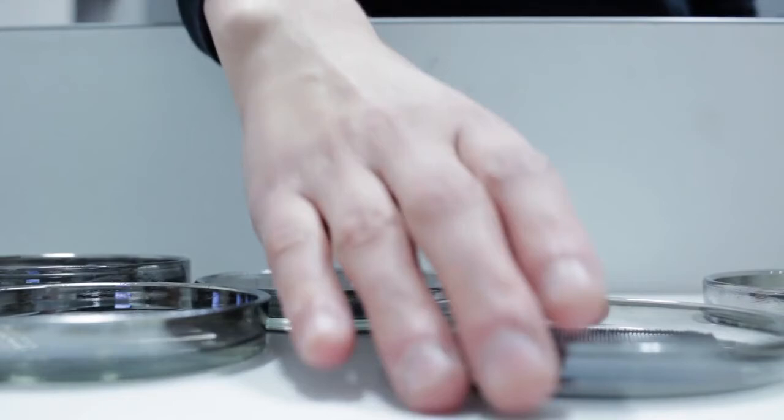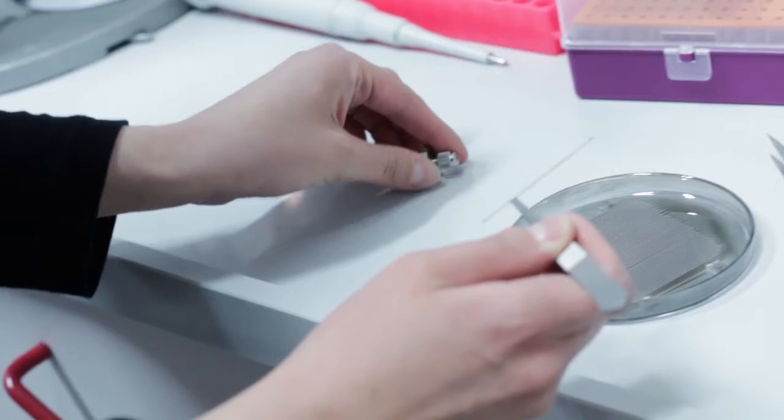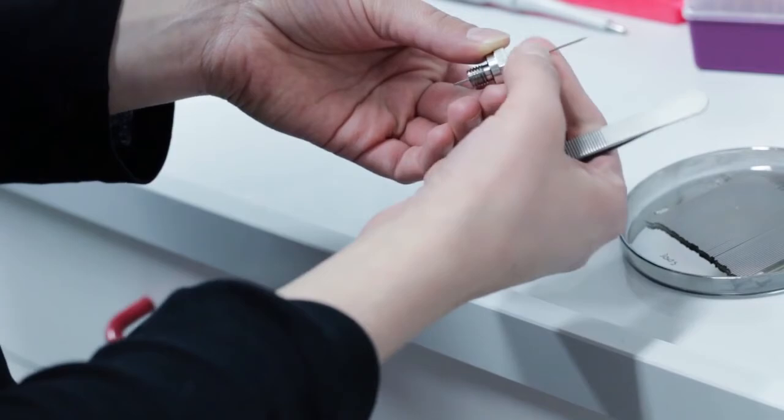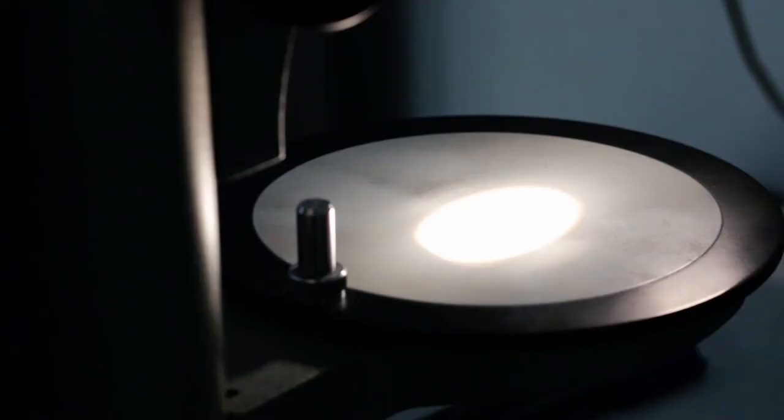At the moment there are three graduate students who work on the instrument as their main source for research, but we also have a variety of undergraduate students and guests who regularly do their experiments there. This is also what I really like about this instrument — it's very versatile. You can either use it for simple routine measurements, and undergrads can also learn to quickly do measurements on their own, but it's also suitable for much more complex investigations.